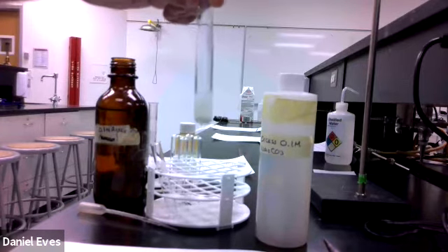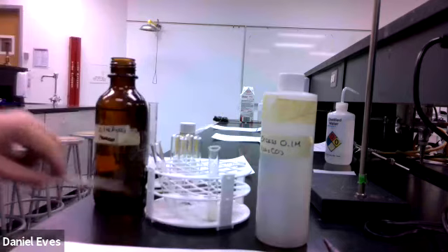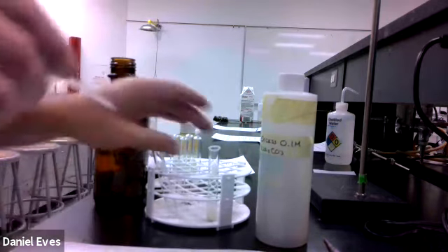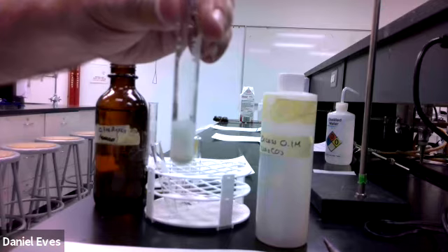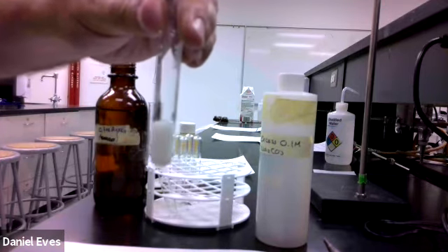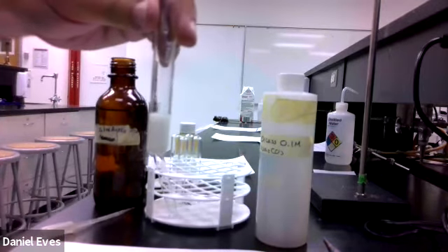The next thing that we're supposed to do is add some more silver and figure out what happens if we add more silver. So I got my bottle of silver nitrate here. Go ahead and get me a little bit of that. I'm going to go ahead and add some more. Let's see if we can see something happen. Do you see more precipitate for me? Okay, so we have more precipitate forming.